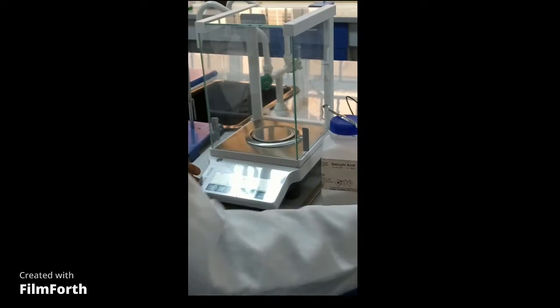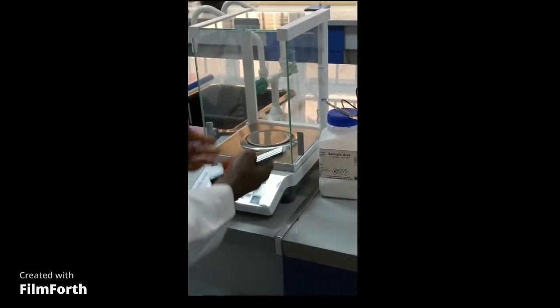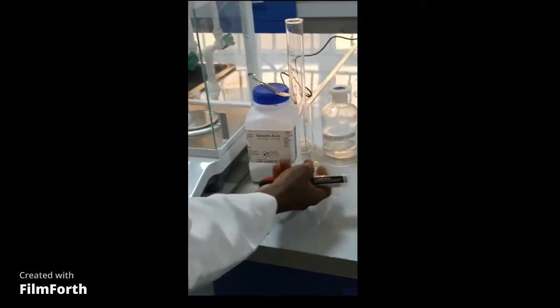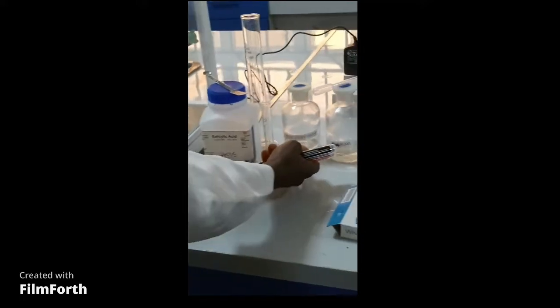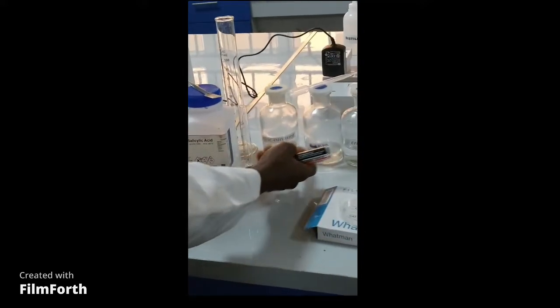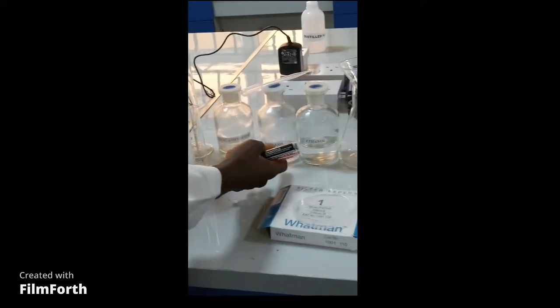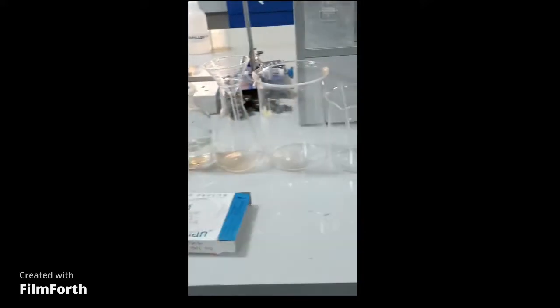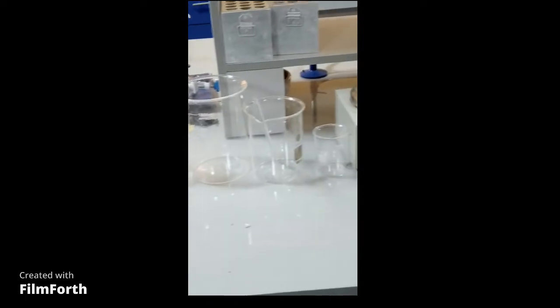These are the materials we are going to use in the synthesis of aspirin: balance, salicylic acid, acetic anhydride, concentrated H2SO4, ethanol, and glassware.